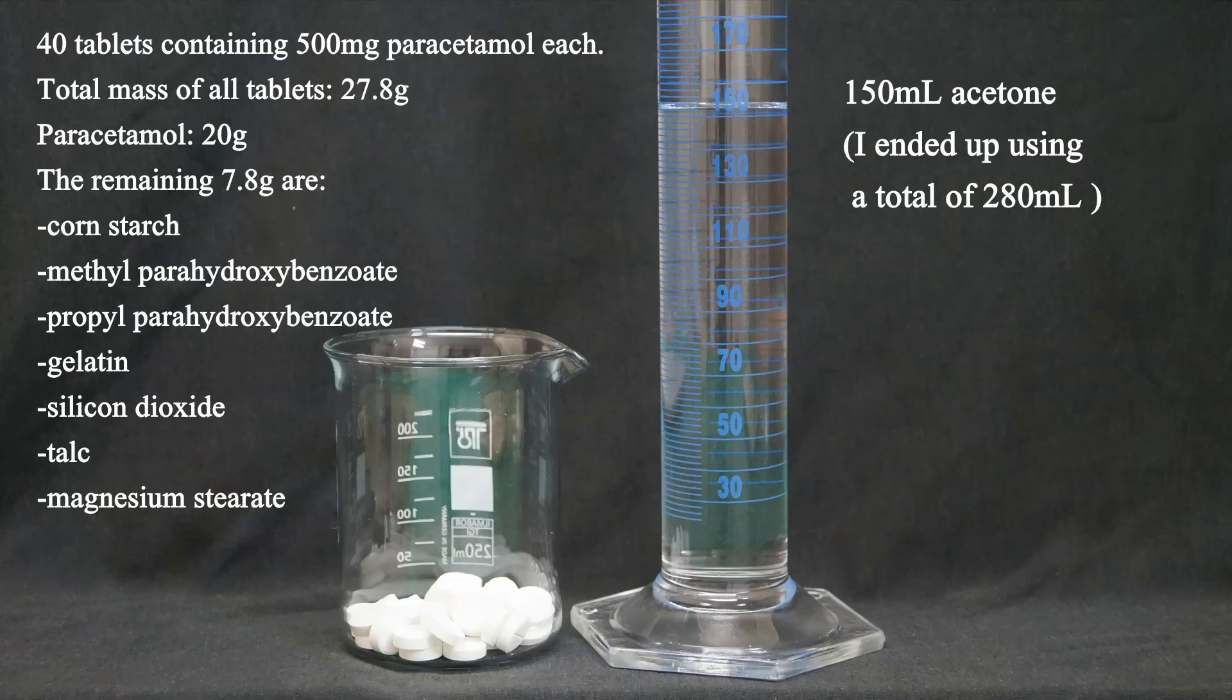In the beaker there are 40 tablets. Each tablet contains 500mg of paracetamol. So the total amount of paracetamol in the beaker is 20g.